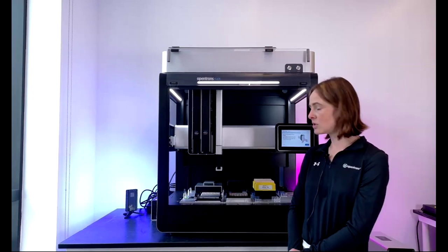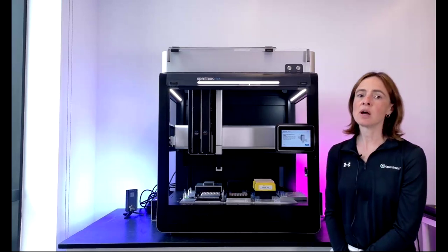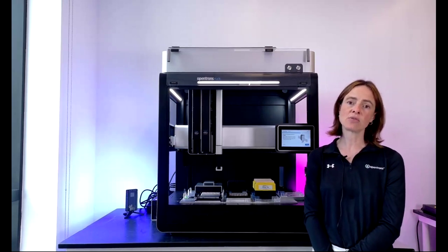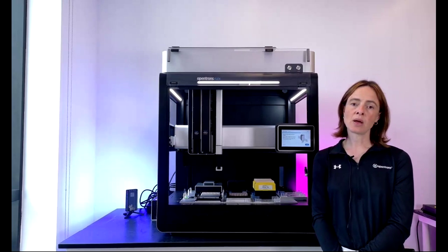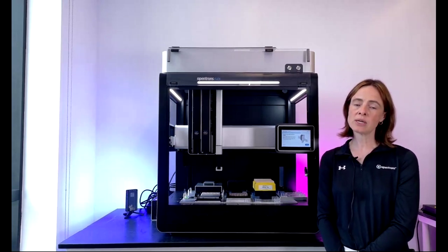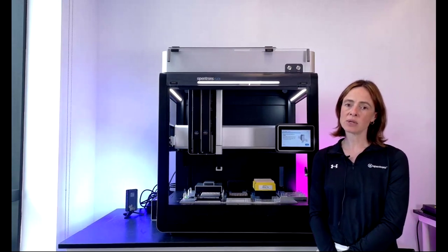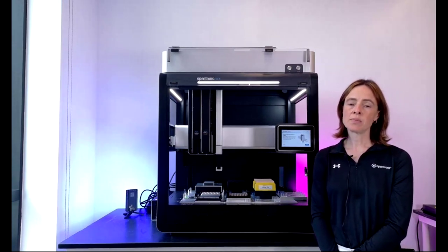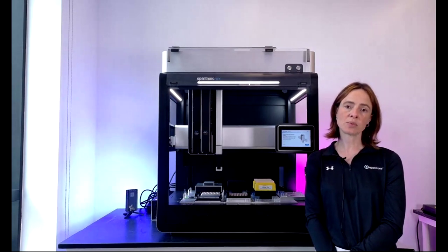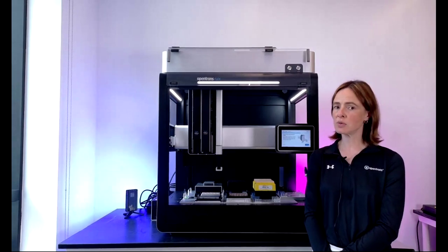Jumping in to talk about the Flex itself, I'm going to show you a few key features on the Flex, and then Nick is going to run through a short demo about finding and configuring a pre-existing protocol from the library, and then running it, and then we'll take questions, as I mentioned. But you can type in your questions at any point, so from now on. Our software engineer, Nick Diehl, is monitoring the Q&A box while we talk, so feel free to ask questions at any point.